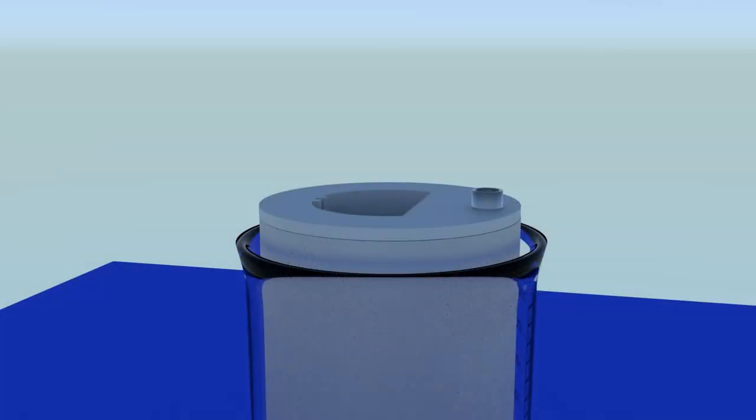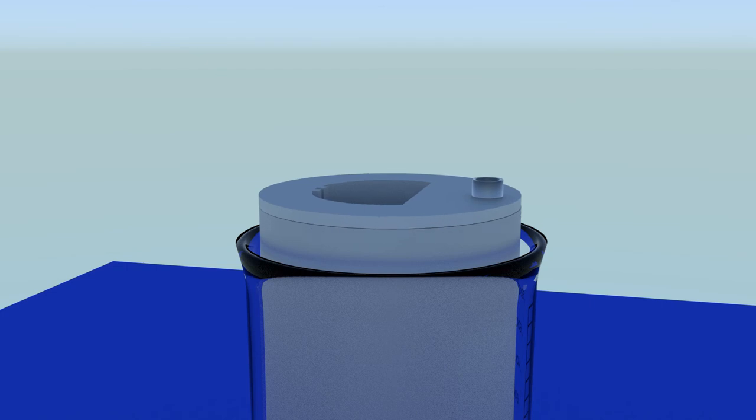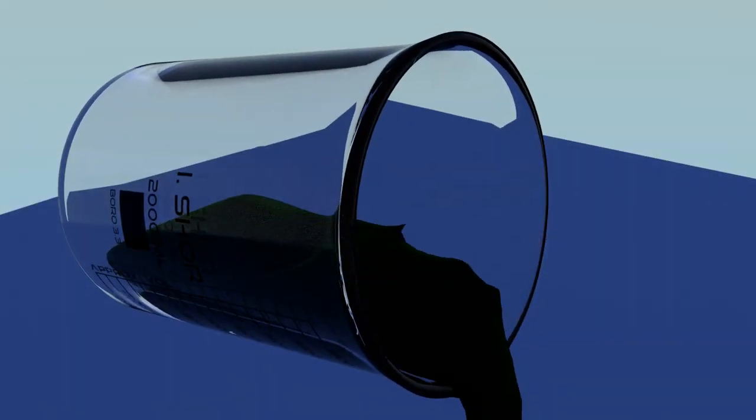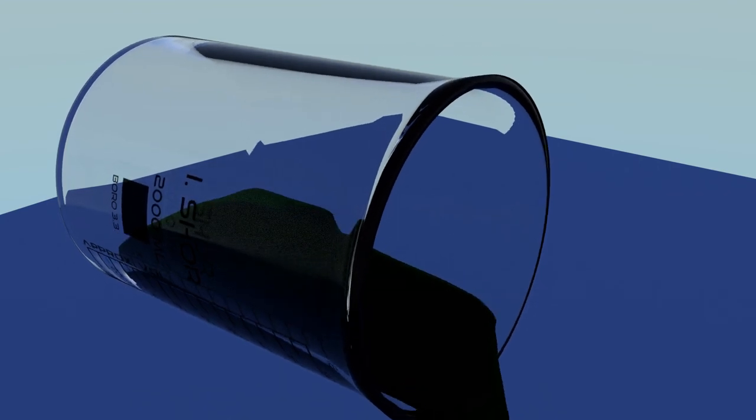Alloys will go into solution, but the platinum metals will convert to insoluble compounds called platinum group chlorides. These compounds, typically red or orange, will adhere to the outside of the ingot and then slough off and fall to the bottom of the pouch. When the process is complete, remove the core. The solution will not contain dissolved platinum group metals and can be discarded.